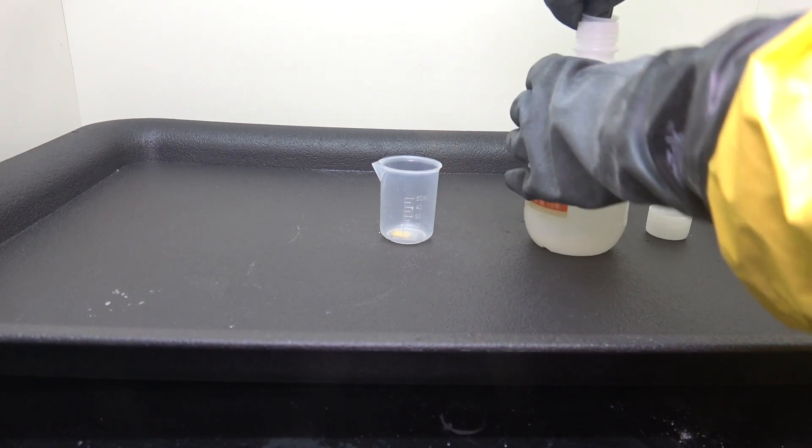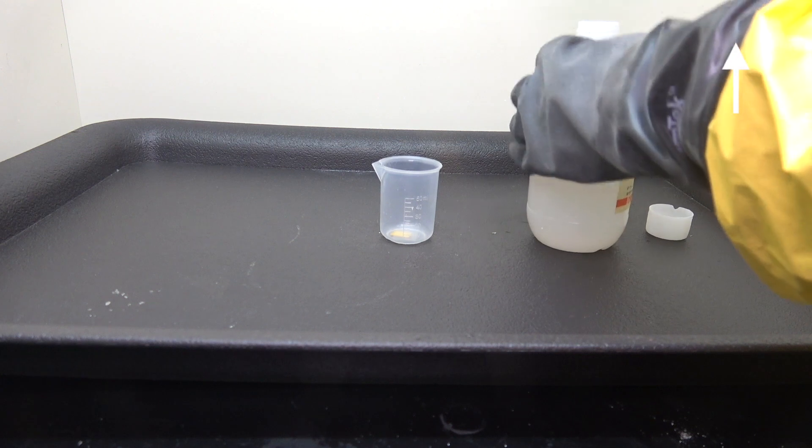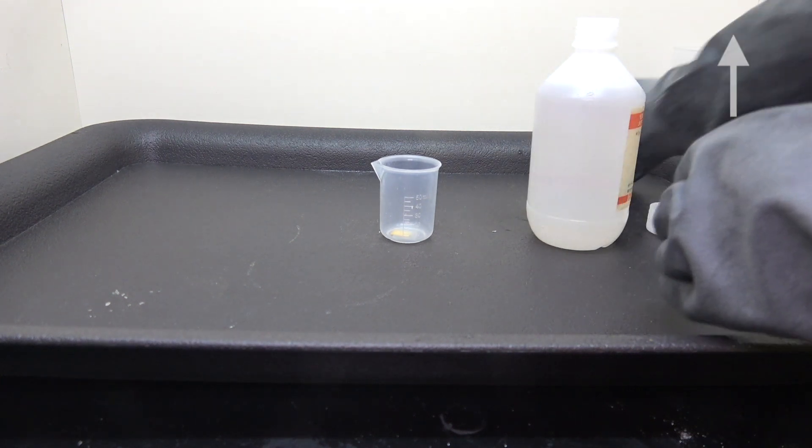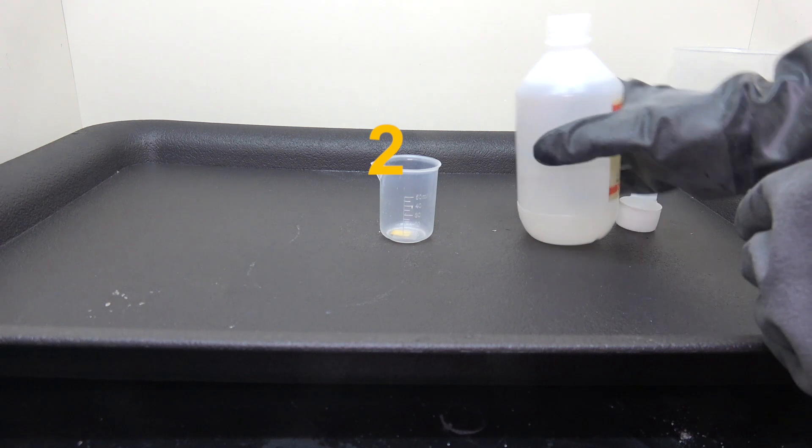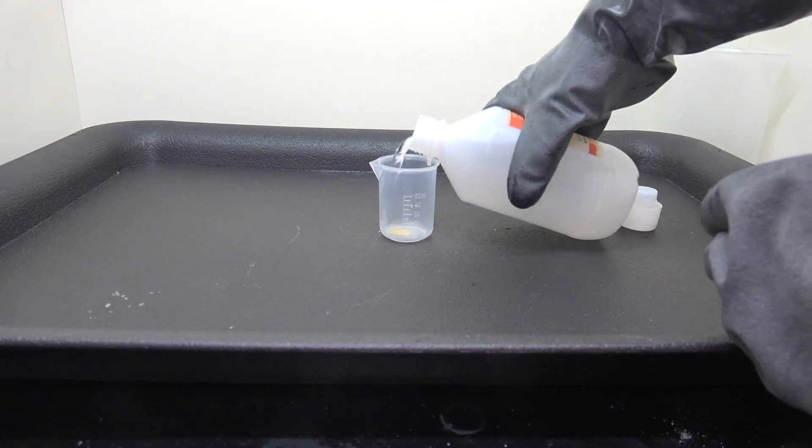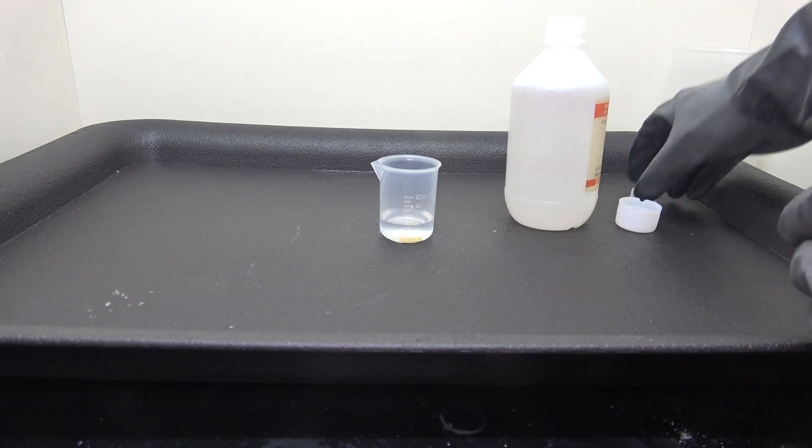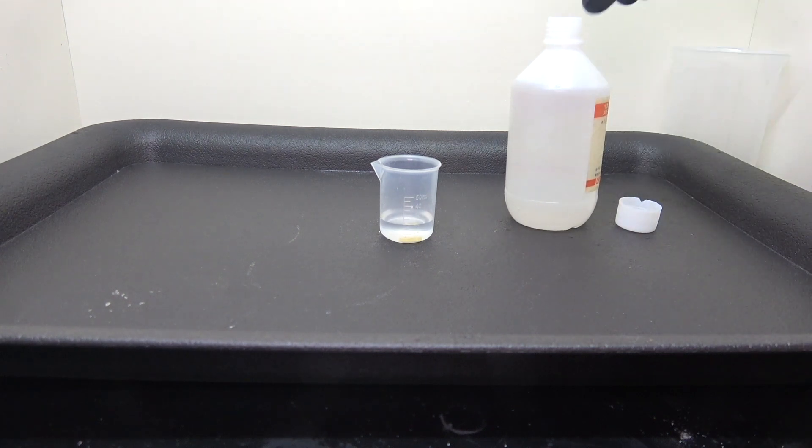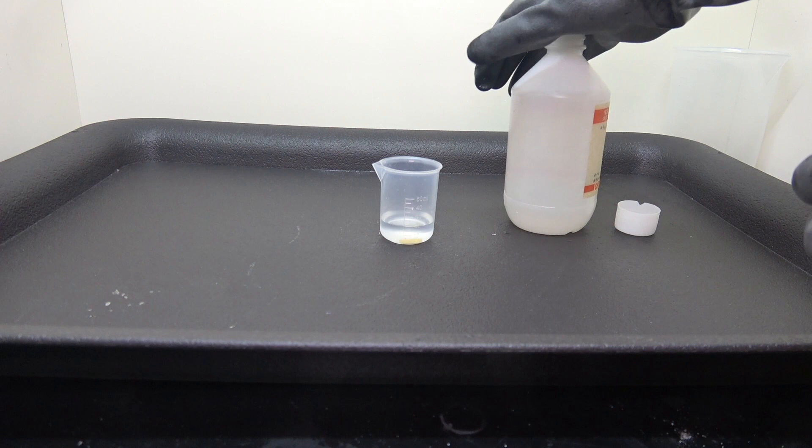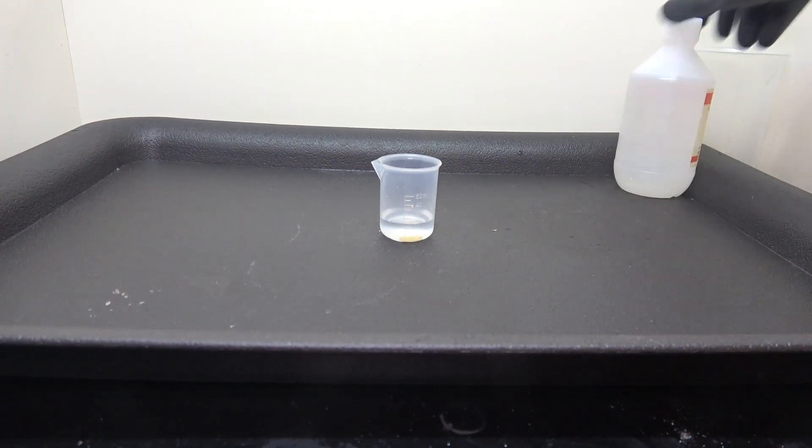Before I dump the acid in there, I would like you to take a guess what you think is gonna happen next. Okay, by the look of it, not a lot has happened at first. Let me quickly pack this time bomb away and wash my gloves. That way I can zoom into the beaker and show you the details.